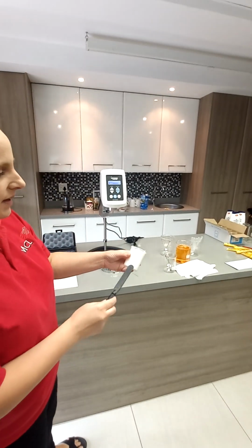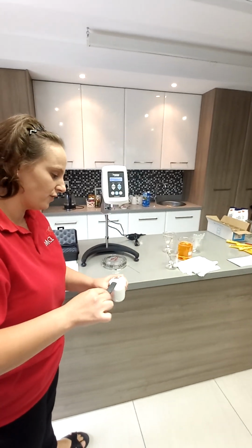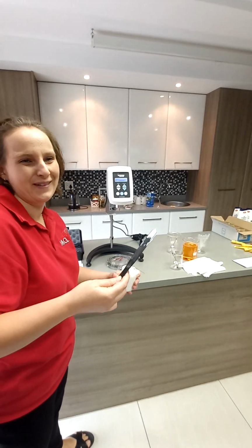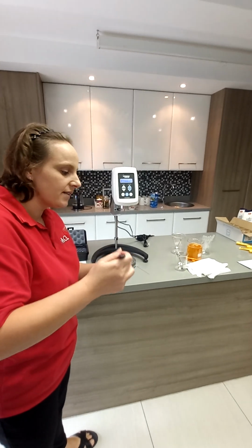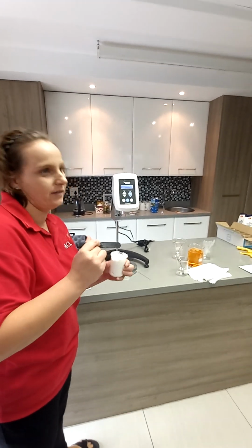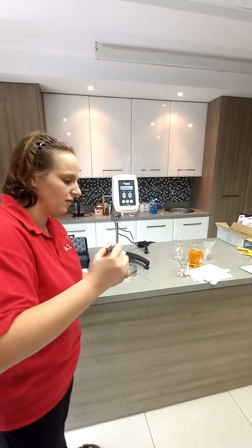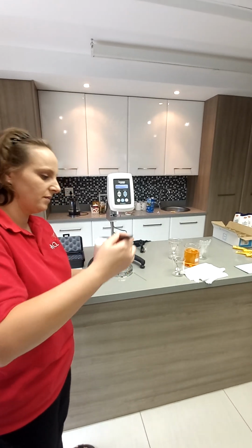There are some air pockets that might affect your reading. Don't know how you're going to get rid of air pockets in cream. It's a bit difficult. But your non-flowings, this is the most trickiest test for viscosities, except if you have a rheometer cone and plate, it's much easier.